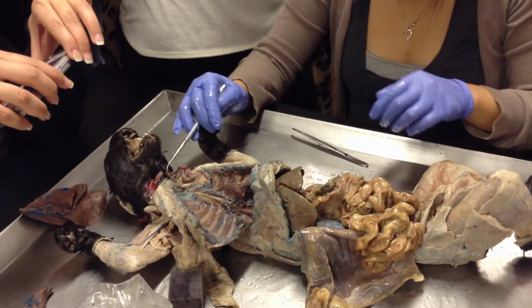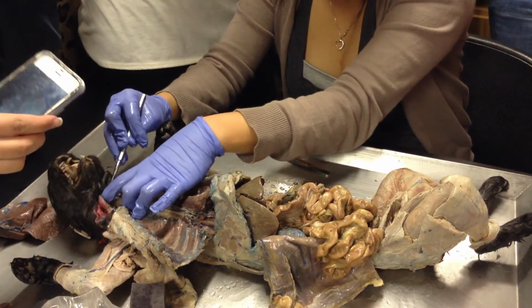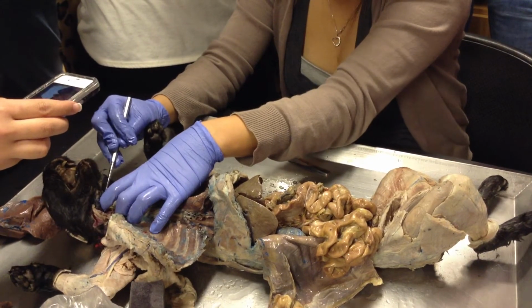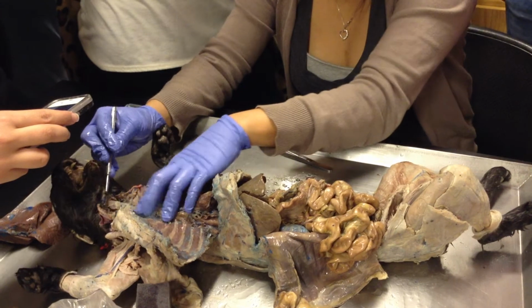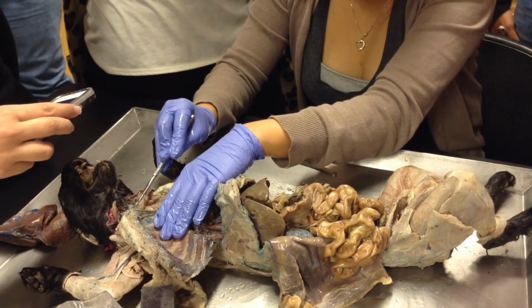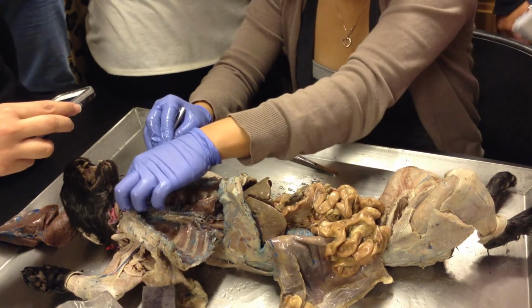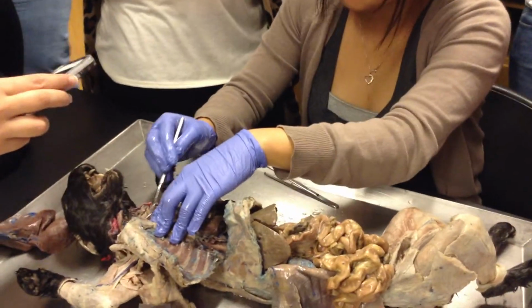Right? On top of the trachea, you guys could see cartilages. The one on the very top, thyroid cartilage. Just below would be the cricoid. And then here we have the tracheal rings, which are made from cartilage. But what is their purpose? To keep the trachea from collapsing. At all times, right?